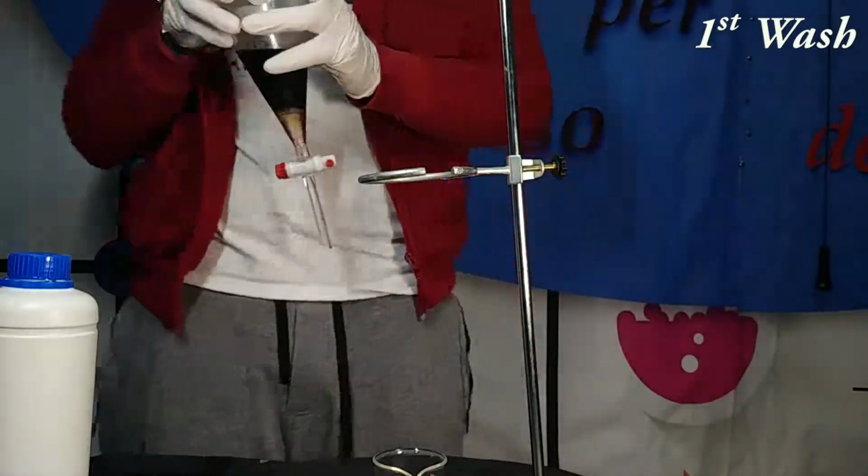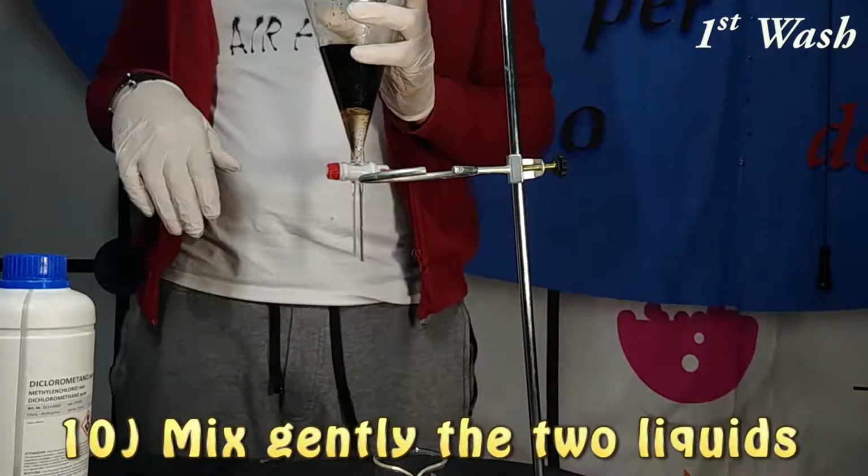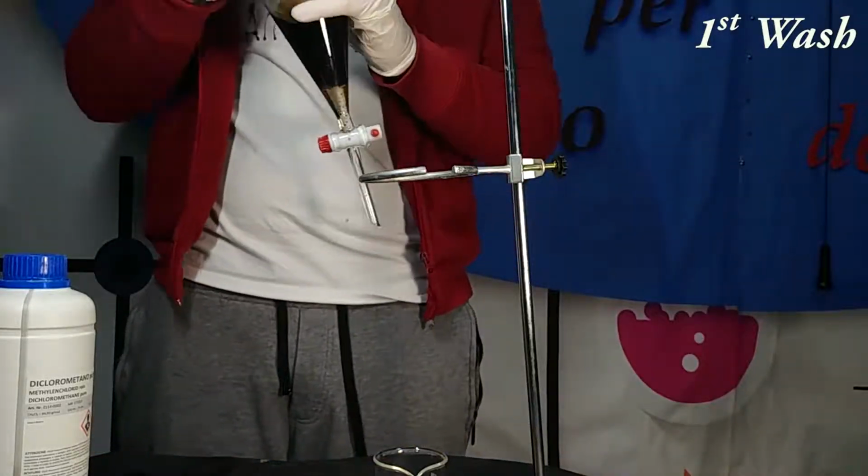Next, we are going to mix and shake a bit this separatory funnel. Be very gentle with it, of course. So this is the extraction step, and in particular we use a different solvent because it is able to solubilize in a special way our caffeine.